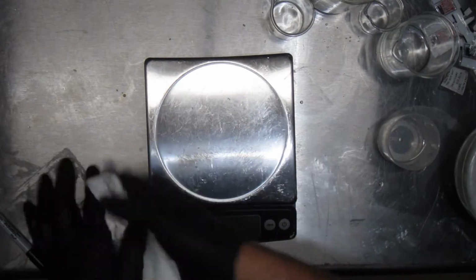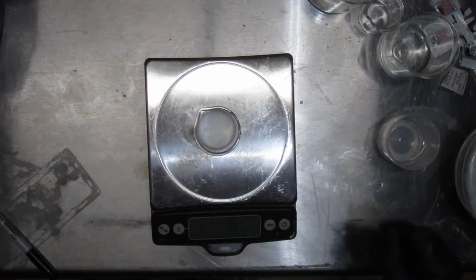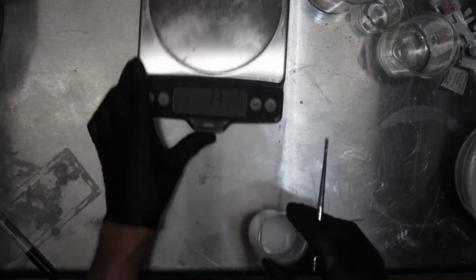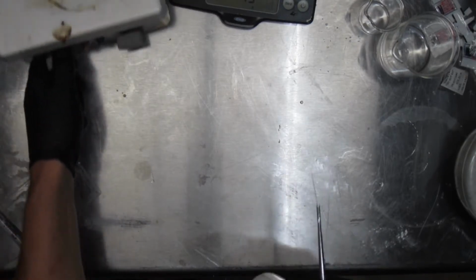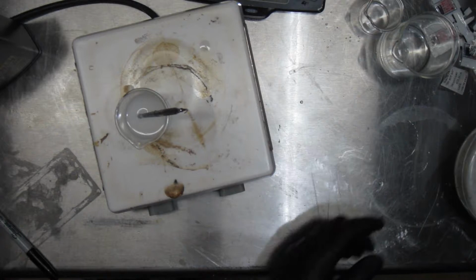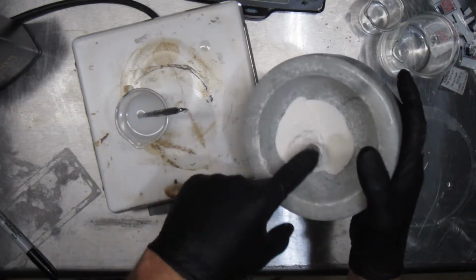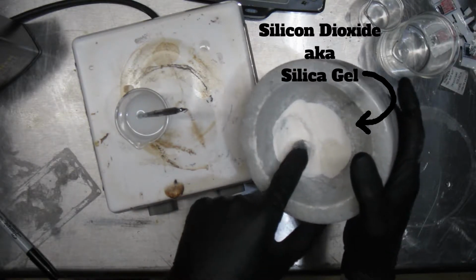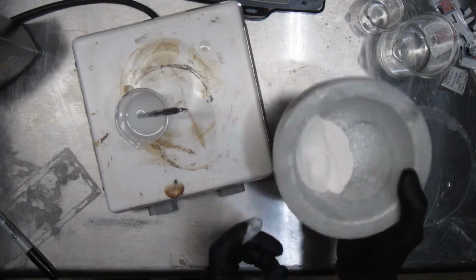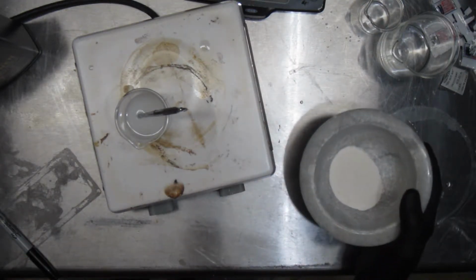Okay, take 2. 24 grams of this stuff. And we're going to do 30 mils of water. Heat and stir, my friends, heat and stir. We'll let that go for a bit, and look, lovely powder. So this is, I think this is what you want to do. Just make sure you have a nice solid surface to smash this out on. This will make it very easy for this to dissolve in that, I'm almost certain.